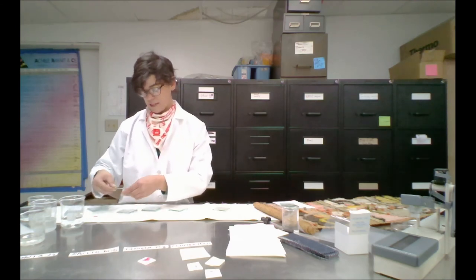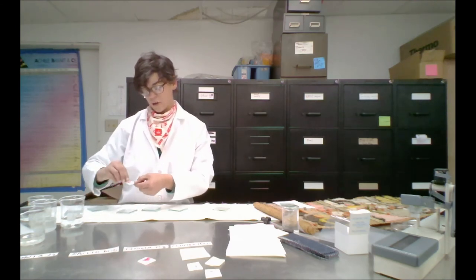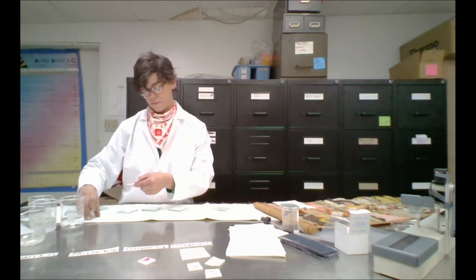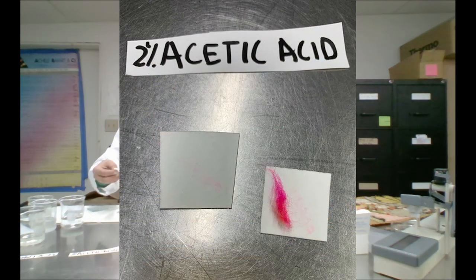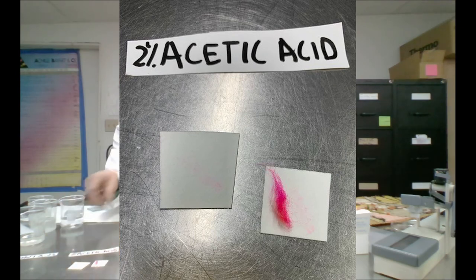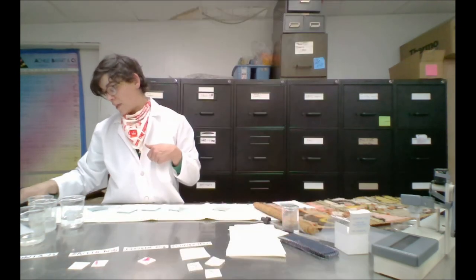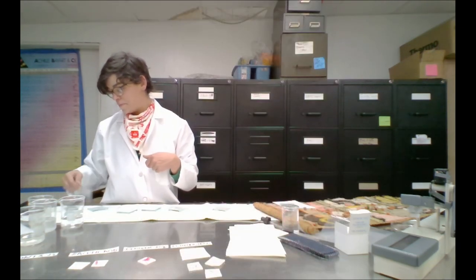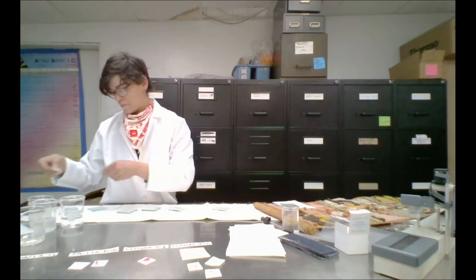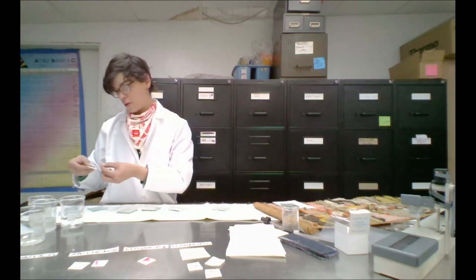The acetic acid had some color transfer, and the final ammonia had no color transfer.